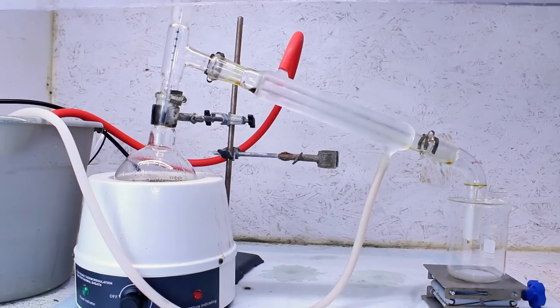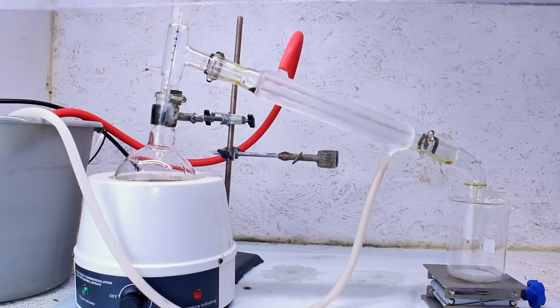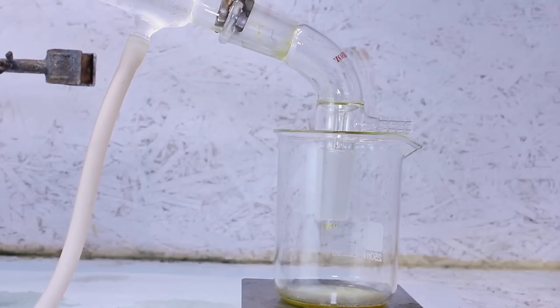I set this up with a thermometer and cranked my heating mantle back up to maximum, and I get my first couple drops of distillate around 80 degrees celsius. This temperature doesn't really make sense for any of the primary byproducts of the thermal depolymerization of polystyrene, so I think what it is is some acetone that didn't fully evaporate.